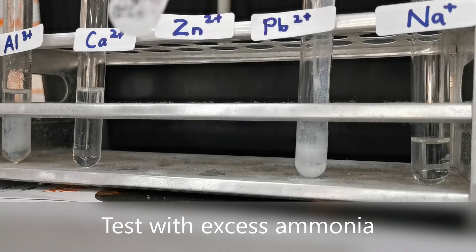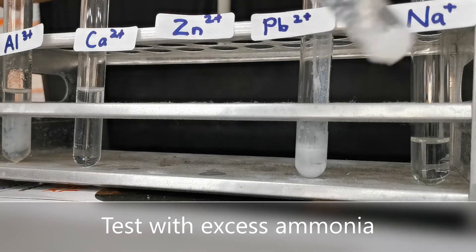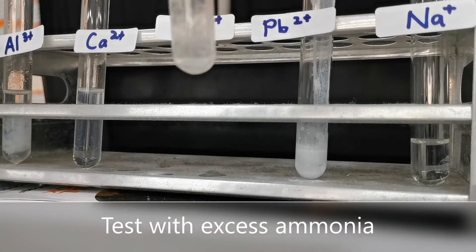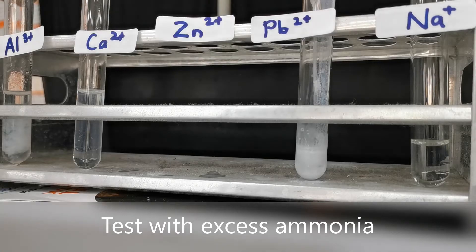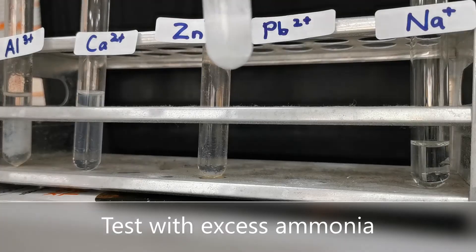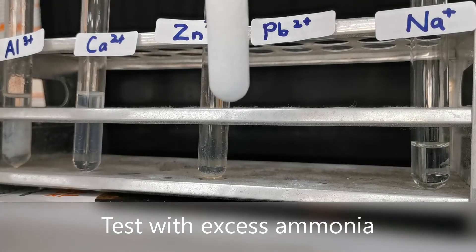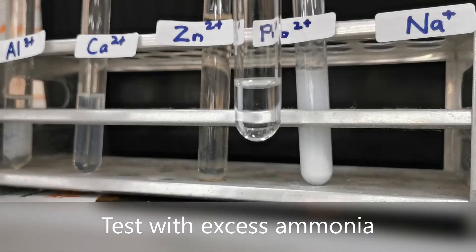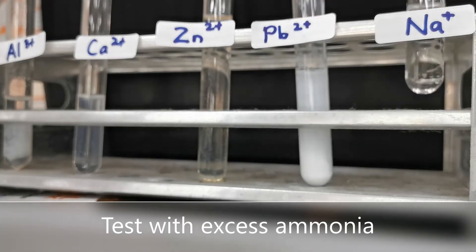For zinc, you can see that the white precipitate starts to dissolve, and all of it dissolves in excess ammonia. For lead in excess ammonia, the white precipitate does not dissolve. There was no change with sodium even with excess ammonia.